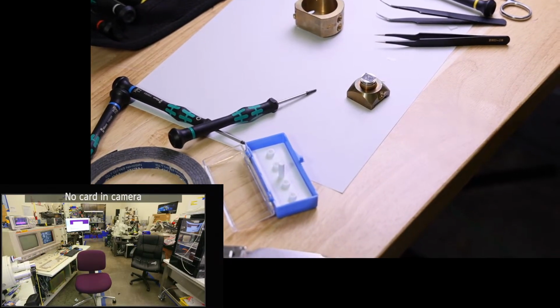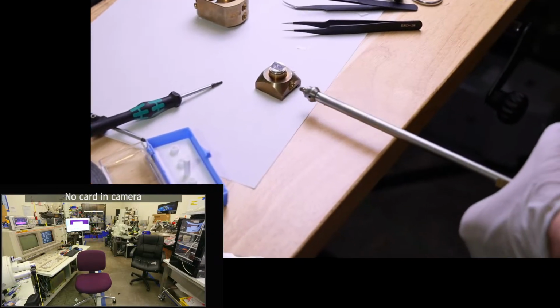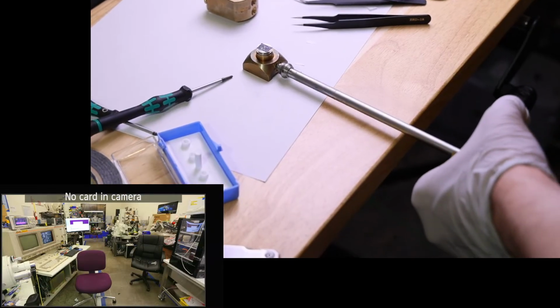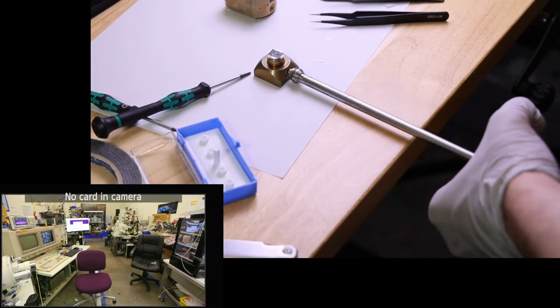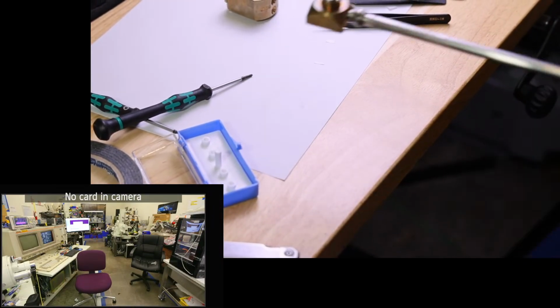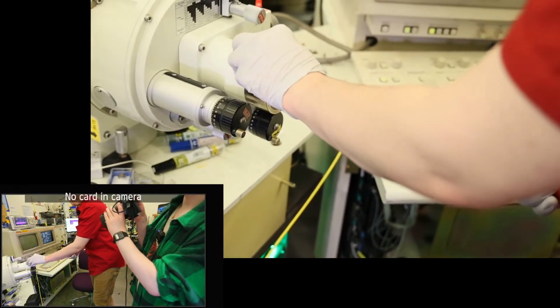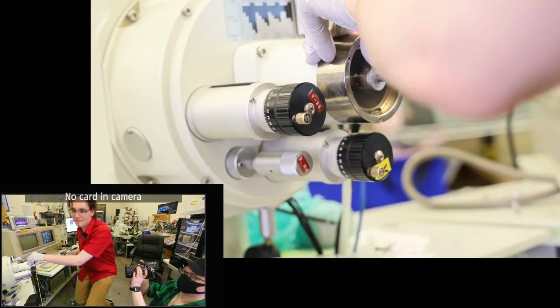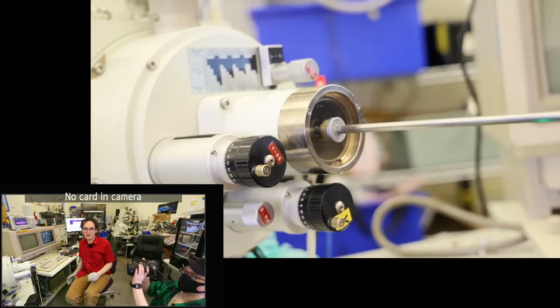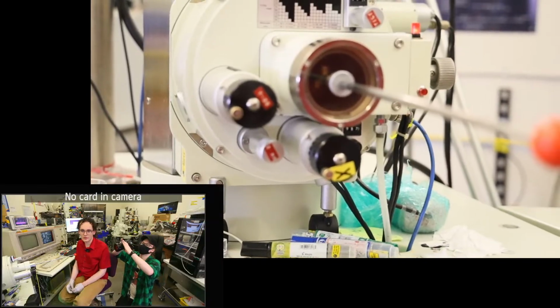And we'll get the sample exchanger out and put it back in the microscope. Go ahead and thread on. Threads caught a little bit earlier than they probably should have, so that's interesting, but that's just fine. Those 4-step tweezers are indeed for holding those stubs. I got a variety of those. I do like those ones. And I got a bunch of different types of tweezers for holding stubs.